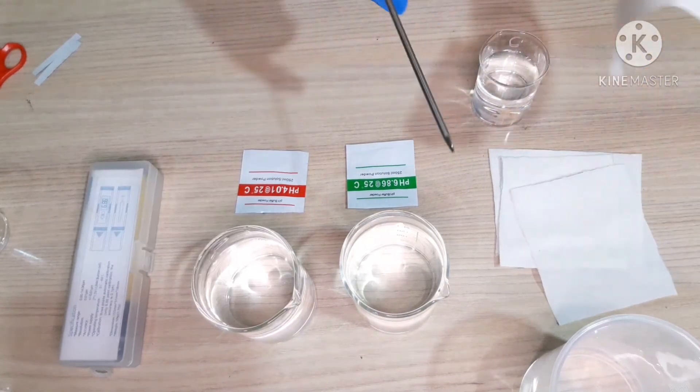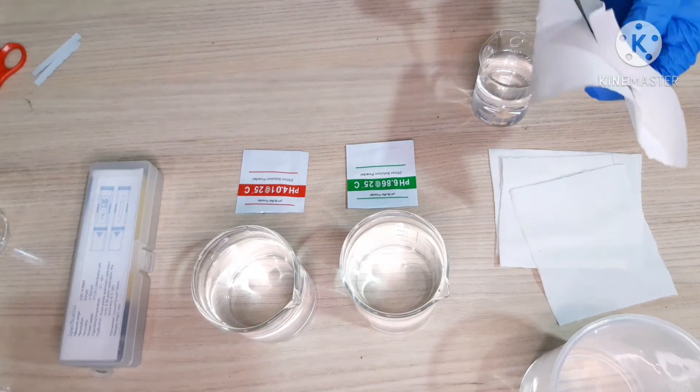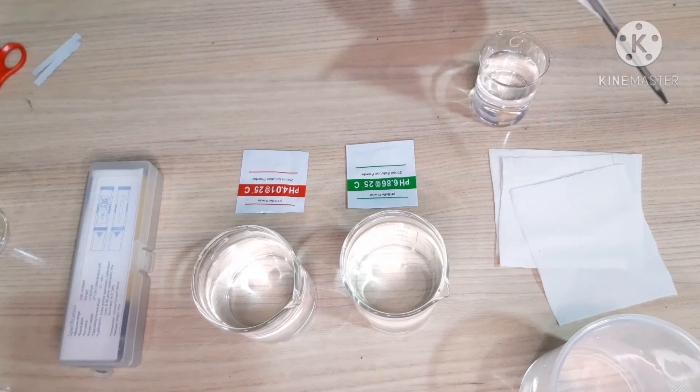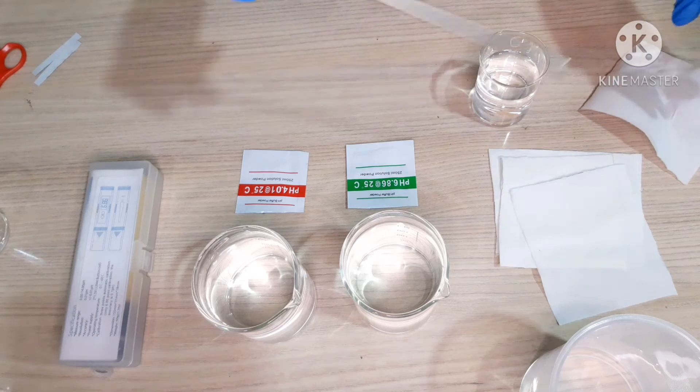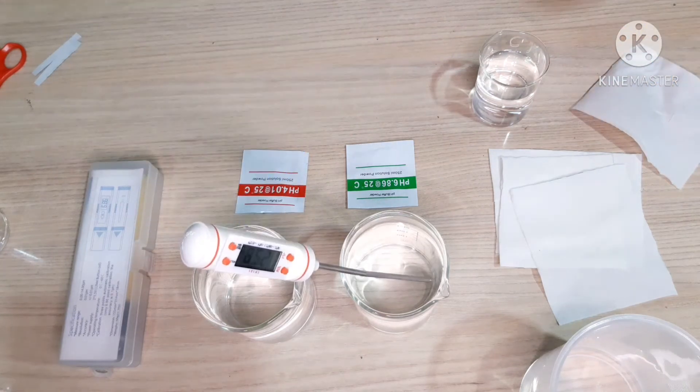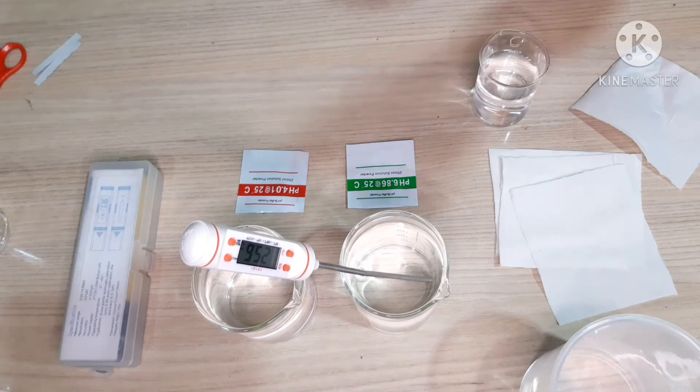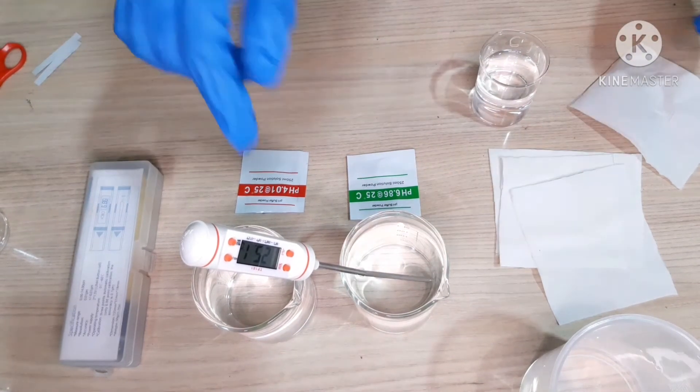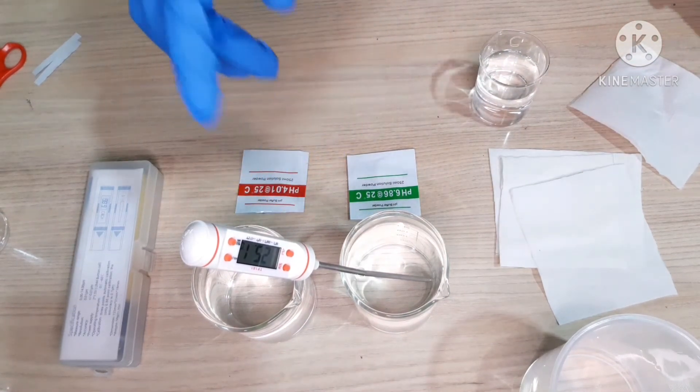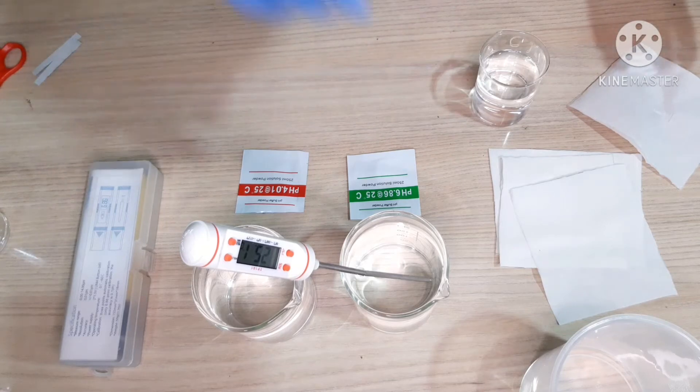So, both the solutions are dissolved properly. We will check the temperature. This is showing 25.1 degree centigrade. Let me check the other solution too.